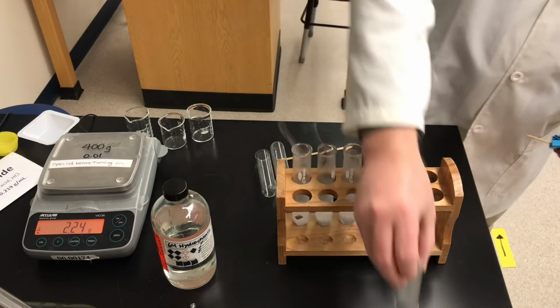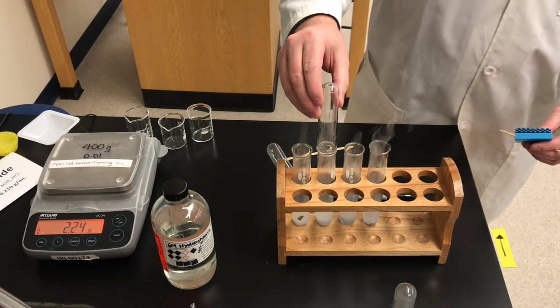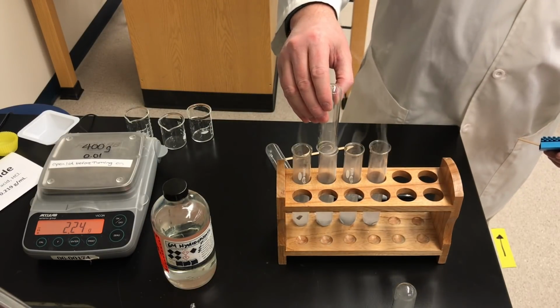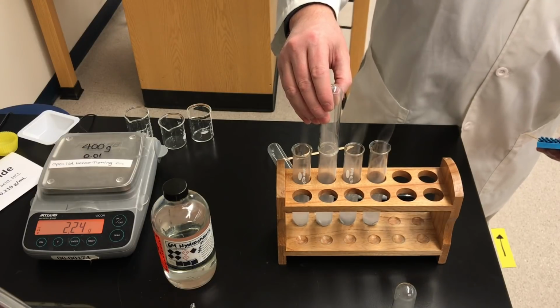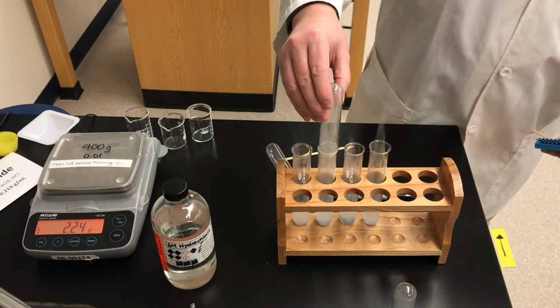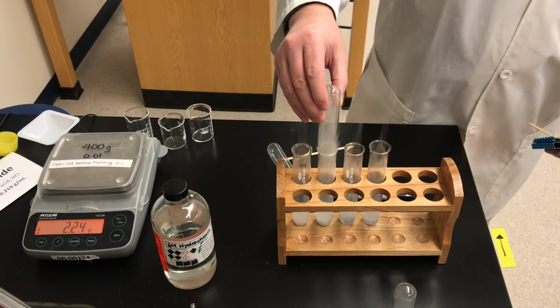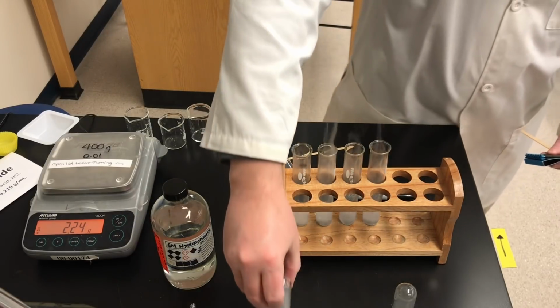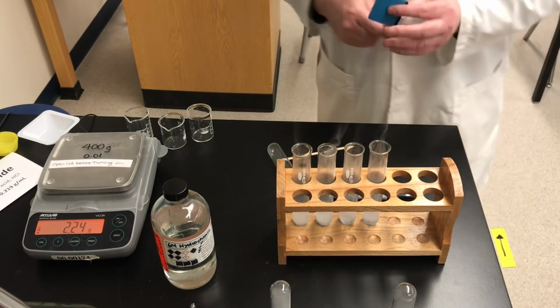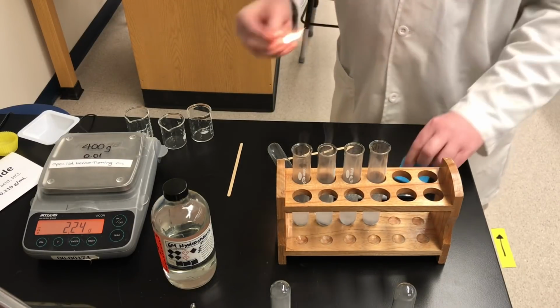I'm going to put the test tube upside down on a bench. I'll do that a couple of times. I've got 3 test tubes, but I think I'll just do it with 2. So I'm collecting the gas just for a few seconds. There we go. So I've got 2 test tubes of this unknown gas, and I'm going to take a match.